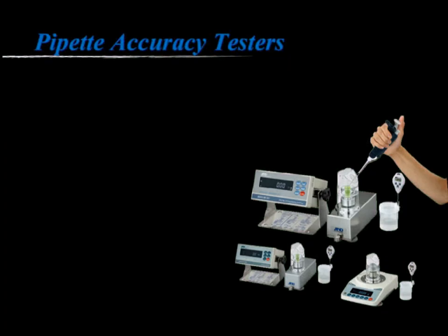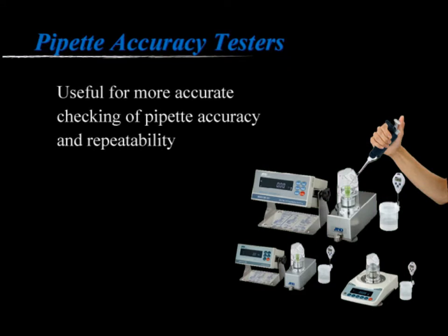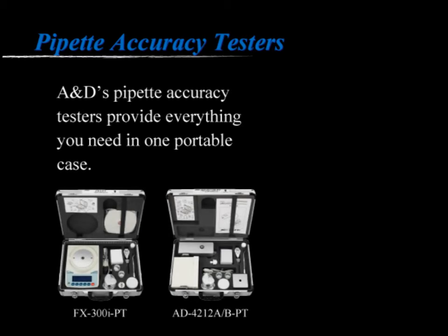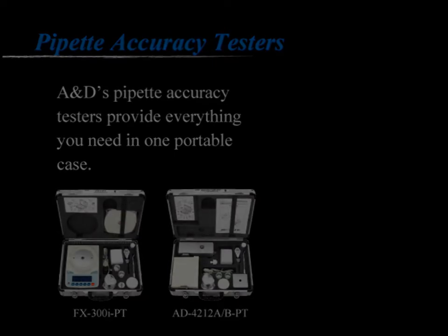The pipette accuracy testers are useful for more accurate checking of pipette accuracy and repeatability. Even when a pipette has no leakage, it can become inaccurate over time. A&D's pipette accuracy testers provide everything you need to know about the performance of your pipettes in one portable case. Just by following a simple procedure, you can be confident that your pipettes are working properly, anytime, anywhere.